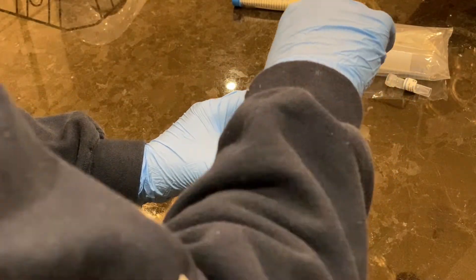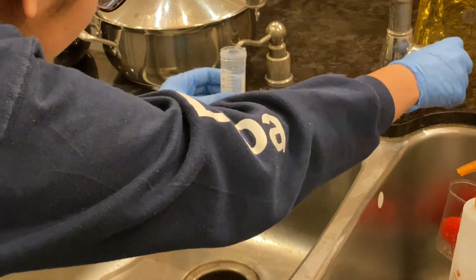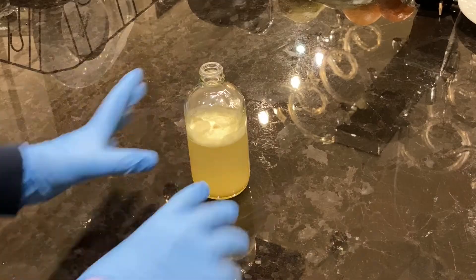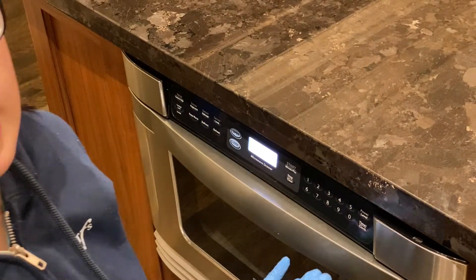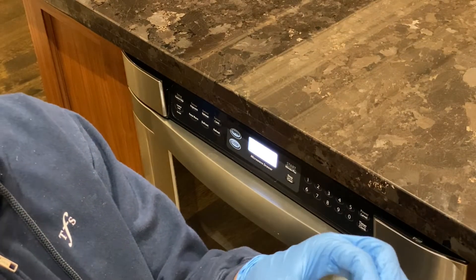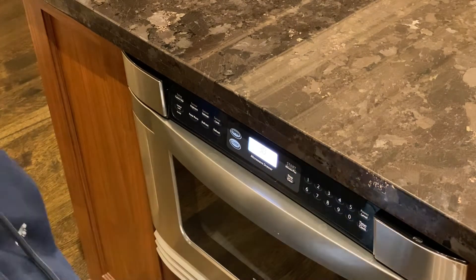In the first part of the experiment, we're going to be preparing everything — put on your gloves. First we're going to be preparing agar plates. To do that, we pour our agar solution into the glass bottle, measure 150 milliliters of water using the measuring tube — the measuring tube is 50 milliliters, so we fill it three times — then put the cap back on and shake the bottle vigorously. Now to melt the agar, we put the bottle into the microwave in multiple sessions of 30 seconds or less. We don't want the agar to boil, so watch out for that. Make sure the lid is unscrewed before you put the bottle into the microwave, otherwise your bottle will explode.